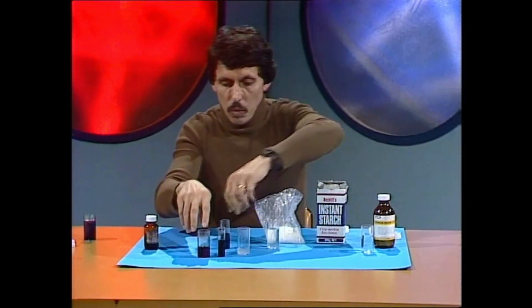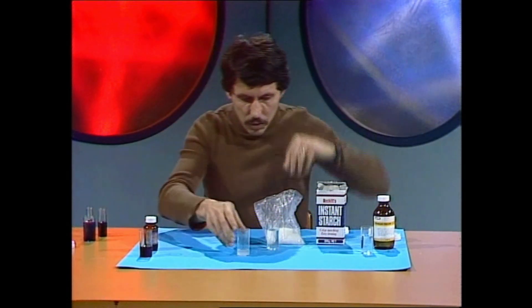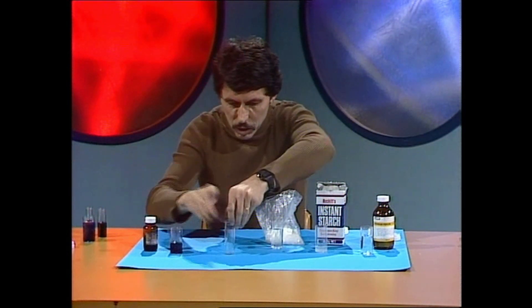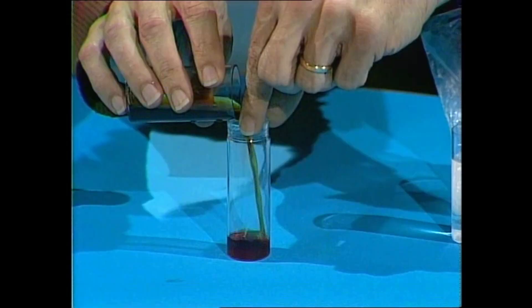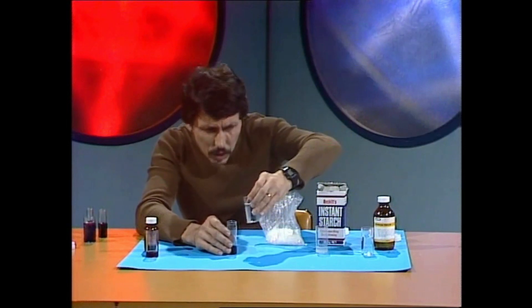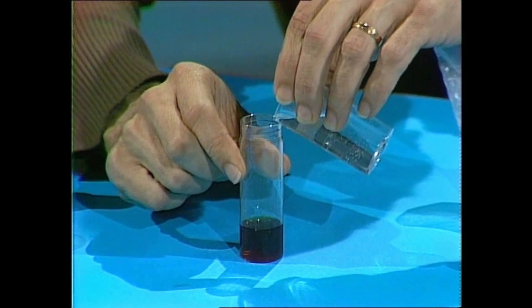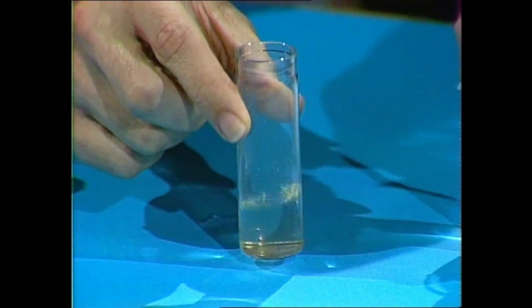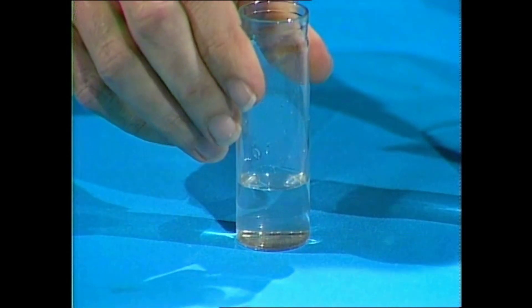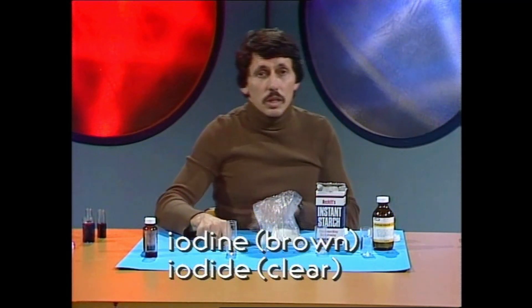Now it didn't occur straight away when we did that time reaction — why not? Well, that's all to do with another one of the things we used, and that's hypo. Let's have a look at what happens if we take some iodine solution and put it in a tablet tube, fill it up to about a quarter full. I added some hypo solution to the iodine — watch carefully — I'll just add a couple of drops and mix it around. You can see the color is fading, and in fact with just a drop or two it goes to a pale yellow and then disappears altogether.